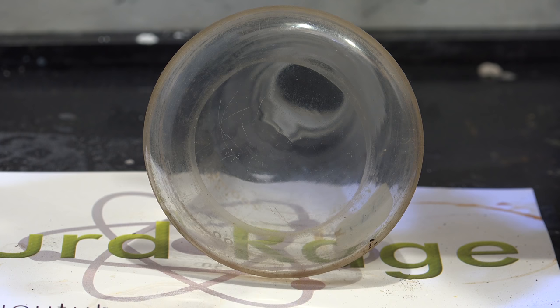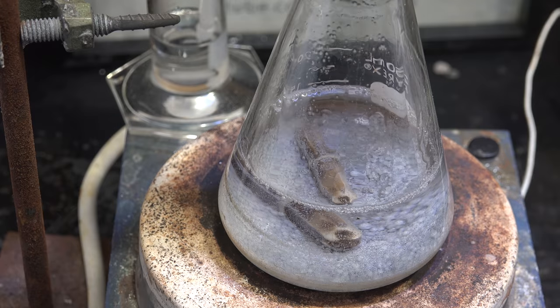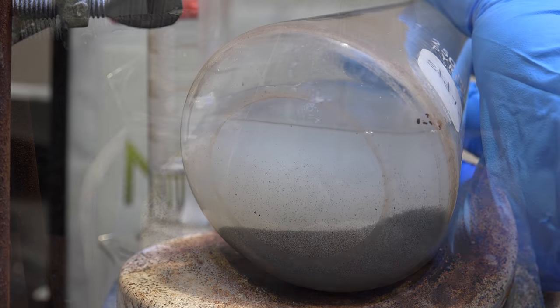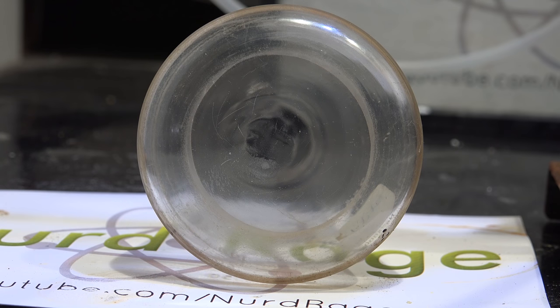So let me get a much better flask and try this all over again. We mix aluminum powder, sodium hydroxide, oil and alcohol and ramp the temperature to 200 celsius over 8 hours. The flask looks pretty good. And here it is after cleaning. We're doing better but it's not perfect. It's very hard to see on camera but there is degradation over here.